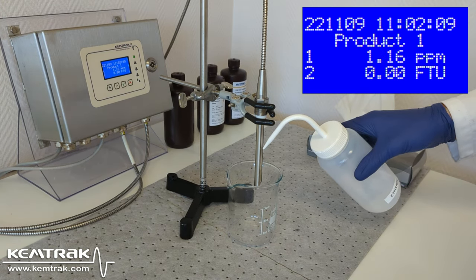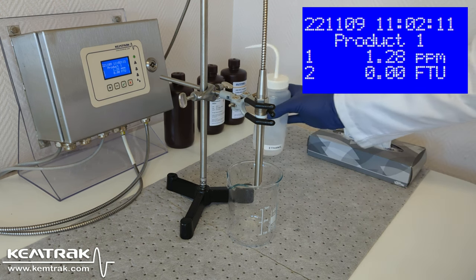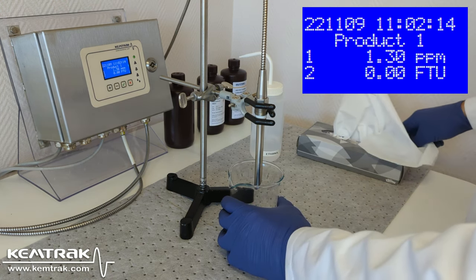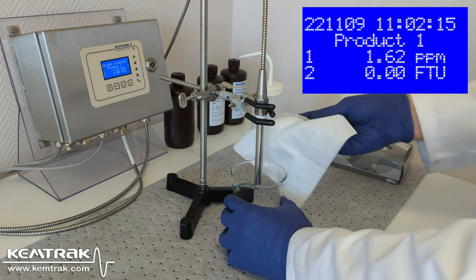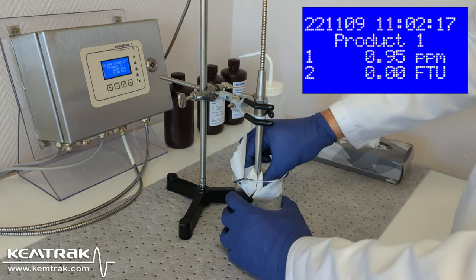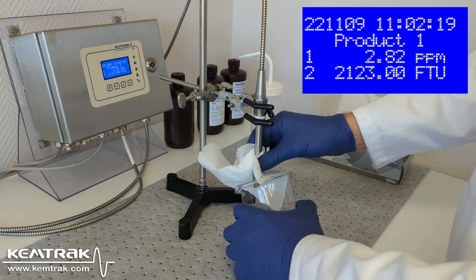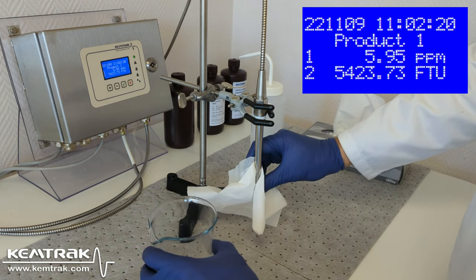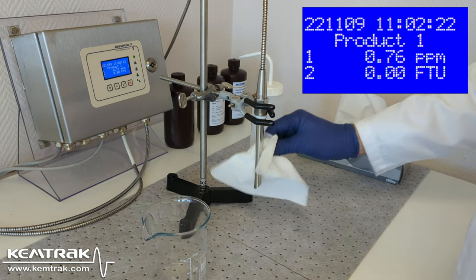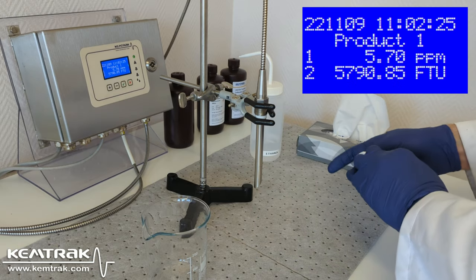To validate, I start by thoroughly cleaning the probe with ethanol, especially the tip of it, and dry it. If the probe is dirty, you can use warm soapy water.